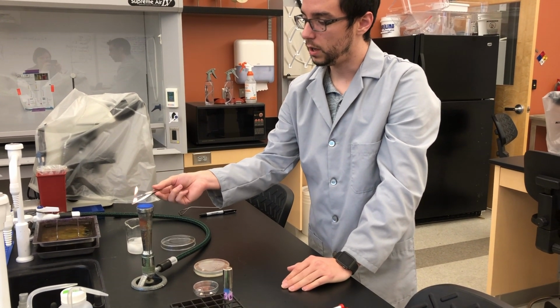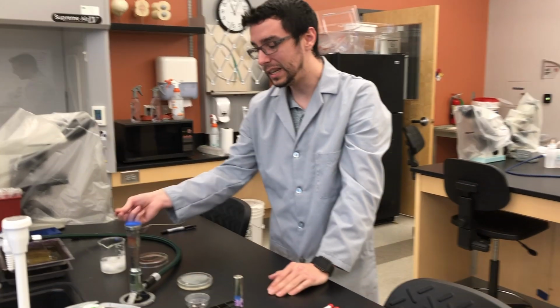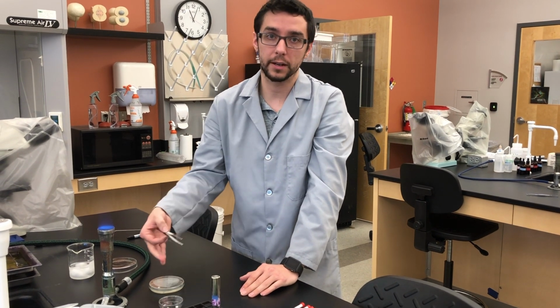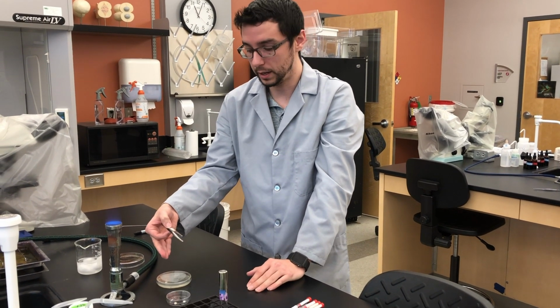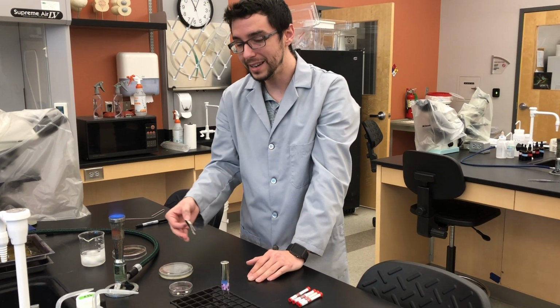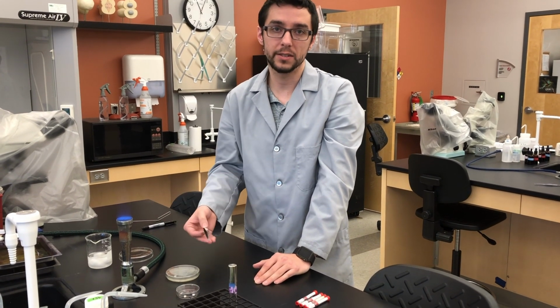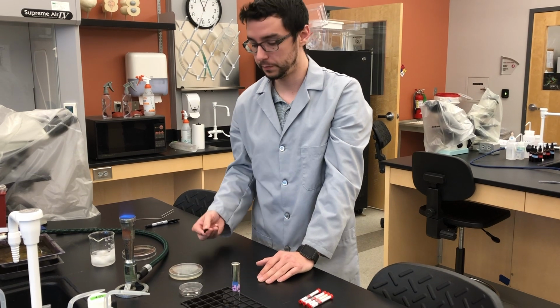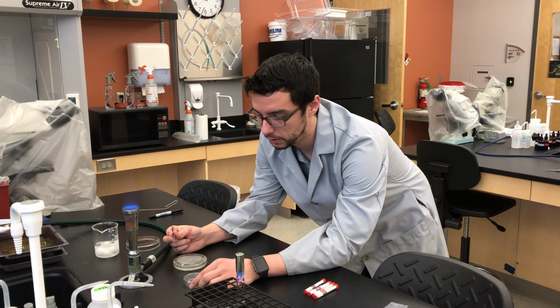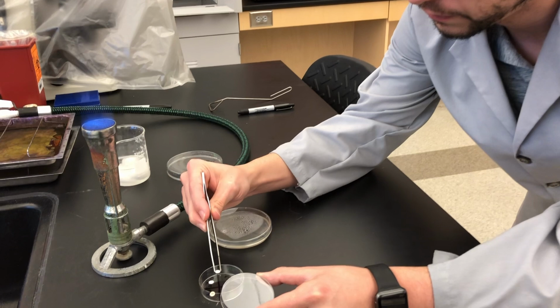Now, if you are using proper sterile technique, you probably don't really need to flame sterilize your forceps every time, because you shouldn't be touching the bacterial culture on the petri dish, because you should only be touching the antibiotic disc when tapping it into place. But just in case you make an error, always flame sterilize in between antibiotic discs, just in case you did touch culture. Okay? So give it a chance to cool off, and then let's go ahead and now get penicillin.